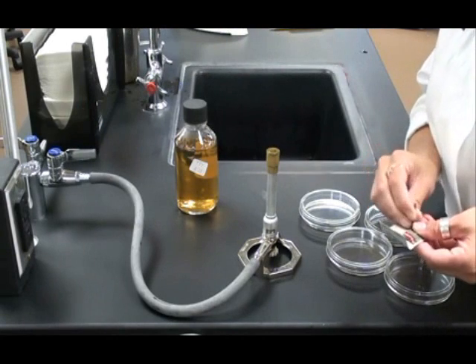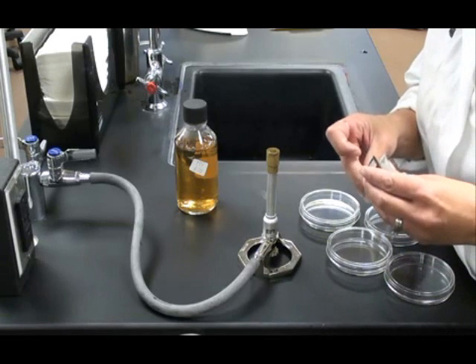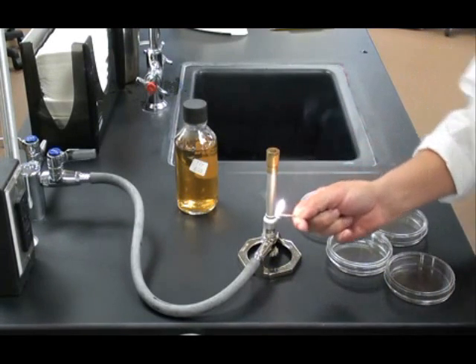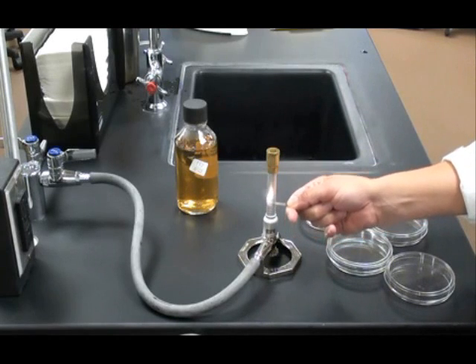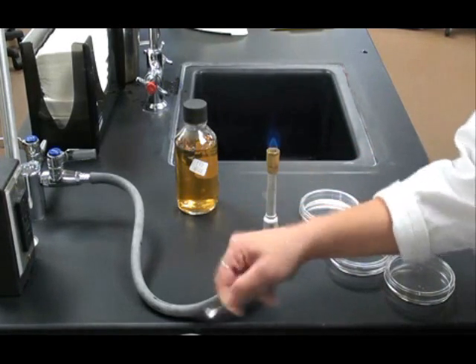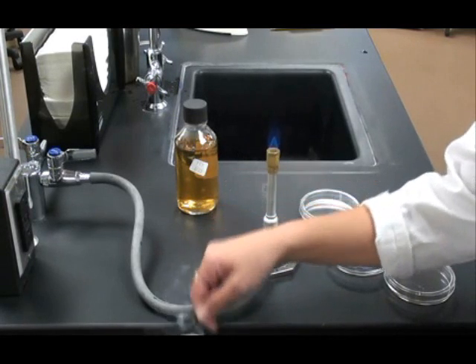I then light my match and run it up the side of the barrel of the Bunsen burner, up the side until it meets the gas and ignites the flame. Don't hold the match over the top of the Bunsen burner. If the flame is set high, you can burn yourself.